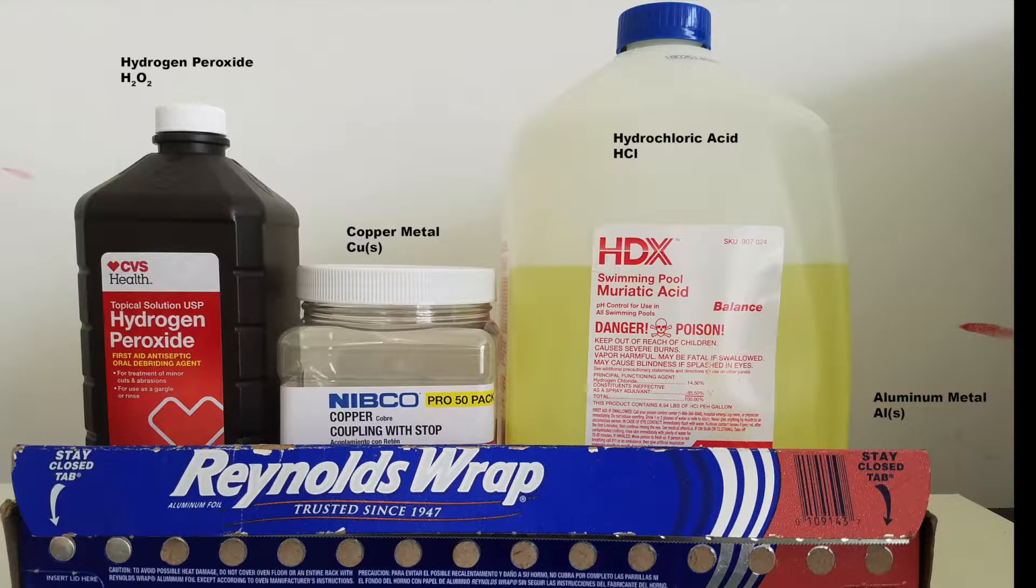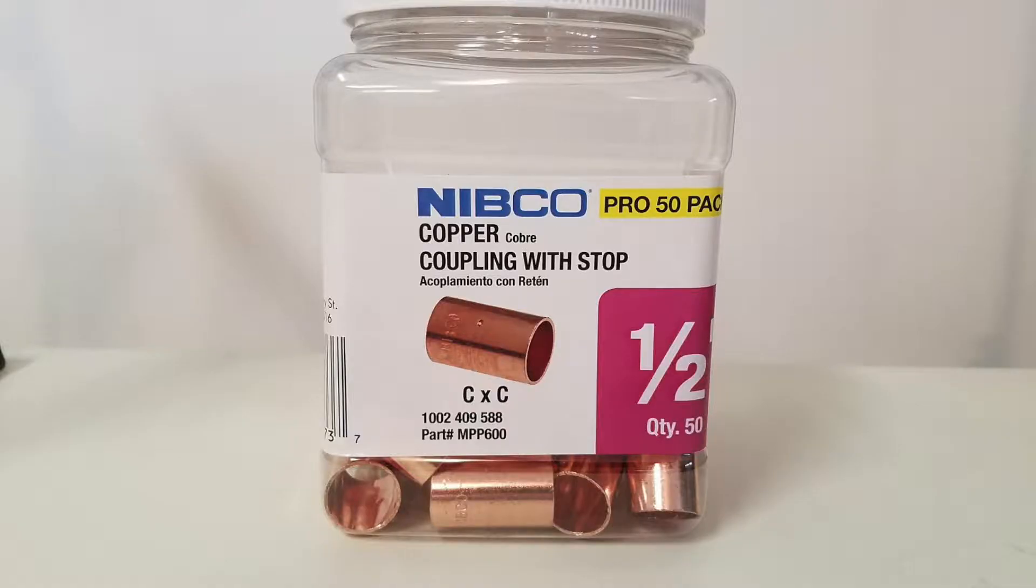I also used aluminum foil at the end to test if the copper was dissolved, but this is an optional step. For the source of copper, I used some copper piping from my local hardware store. I'm not sure how pure the copper was, but it seemed to work.